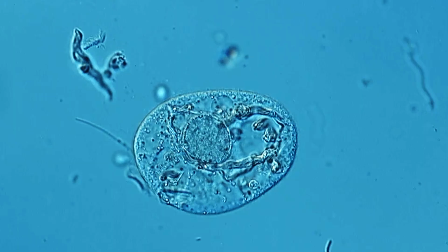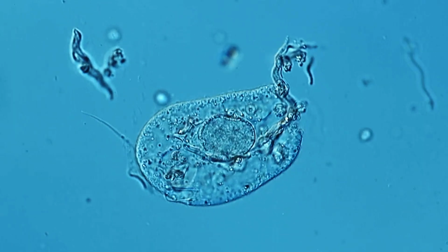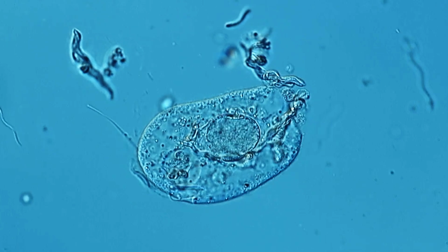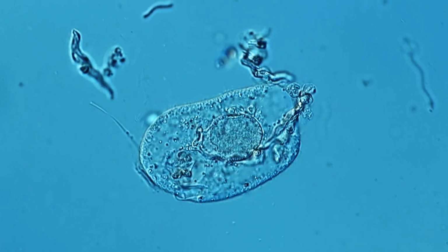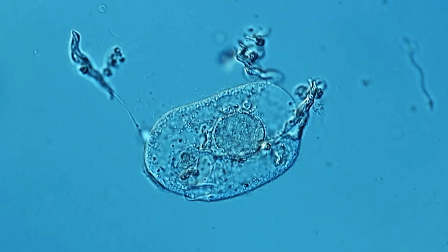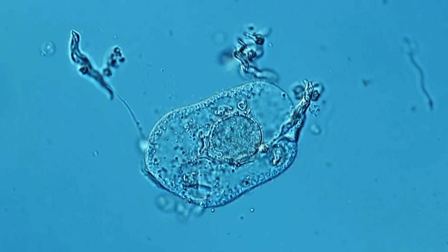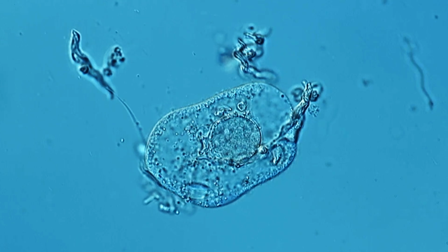And when the disinfectant reaches those ciliates, then they start to slow down. So as the disinfectant starts to act, I could see that actually it stops moving, and then the cell burst open and the contents were spilled out. So you see that those cells too can be easily removed using hydrogen peroxide and or alcohol.